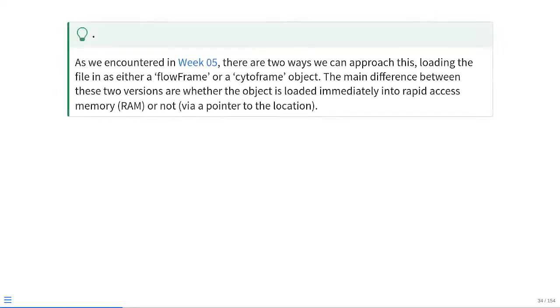So if you remember back to week 5, there are two ways that we can load in FCS files into R. We can load them in either as a flowFrame object or as a cytoframe object. The main difference between these two versions is whether the object is loaded immediately into our random access memory or our RAM or not, whereby it's working via a pointer pointing at wherever it is on our hard drive, solid state drive, NVMe drive, whichever storage device you have.